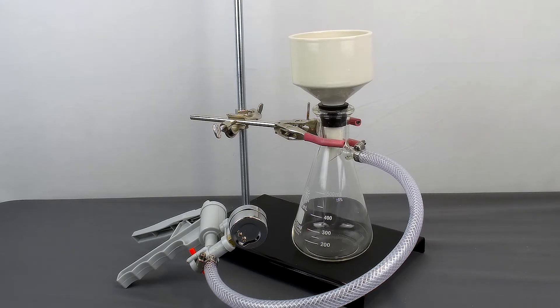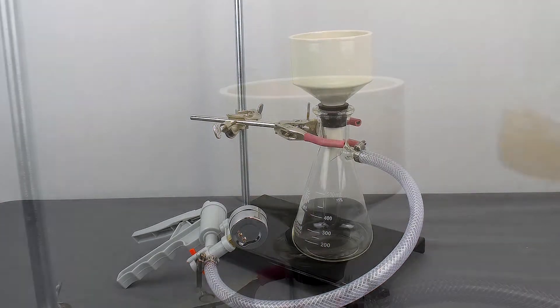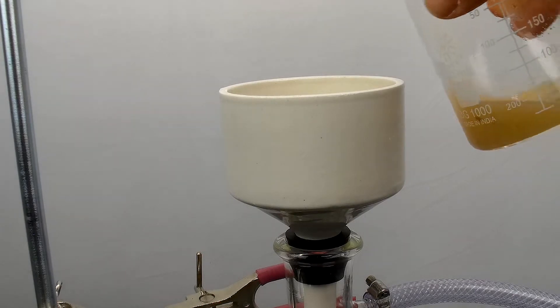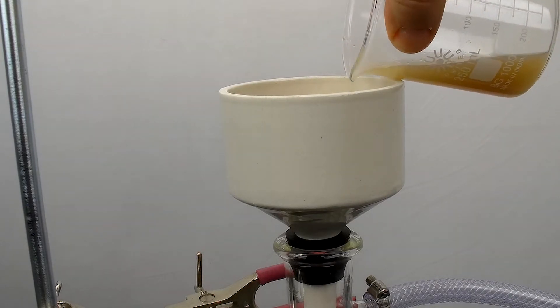Now let's look at a quick experiment here to see the advantages of using a vacuum filtering system. I'm going to place in the solution that I'm working with.